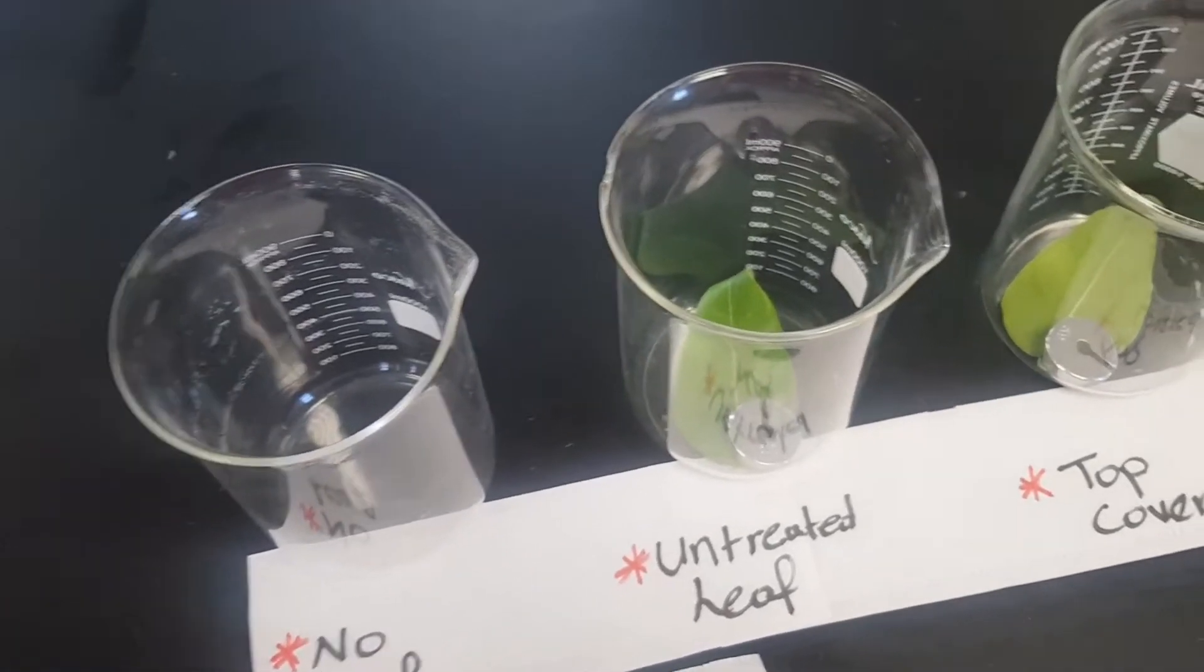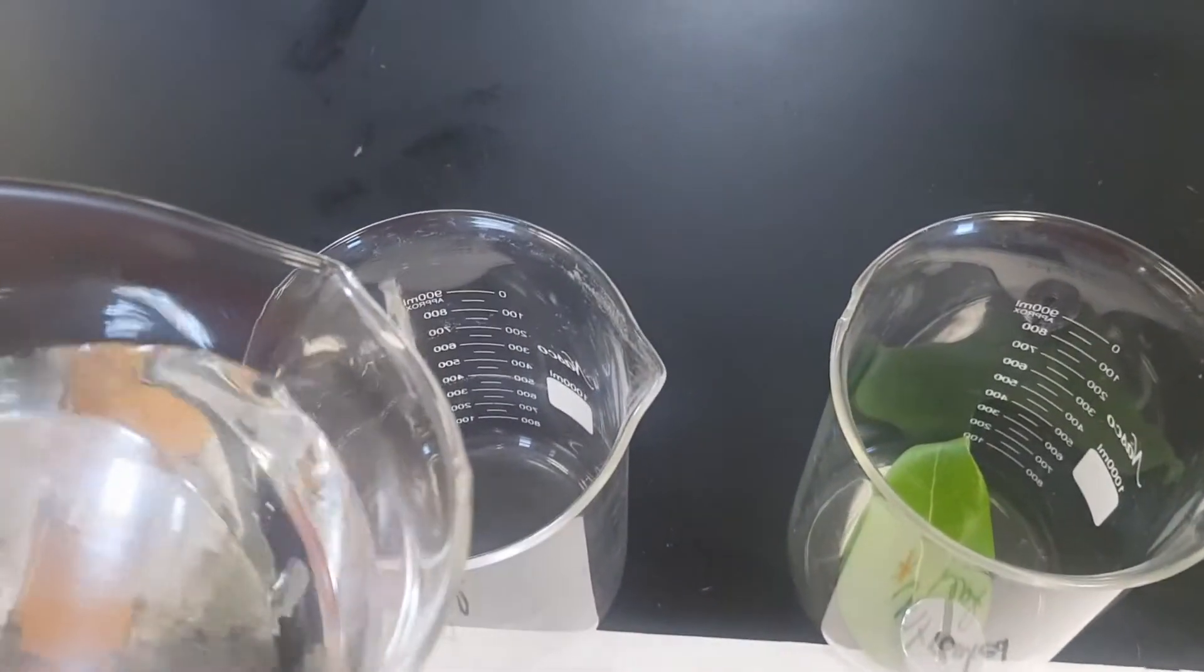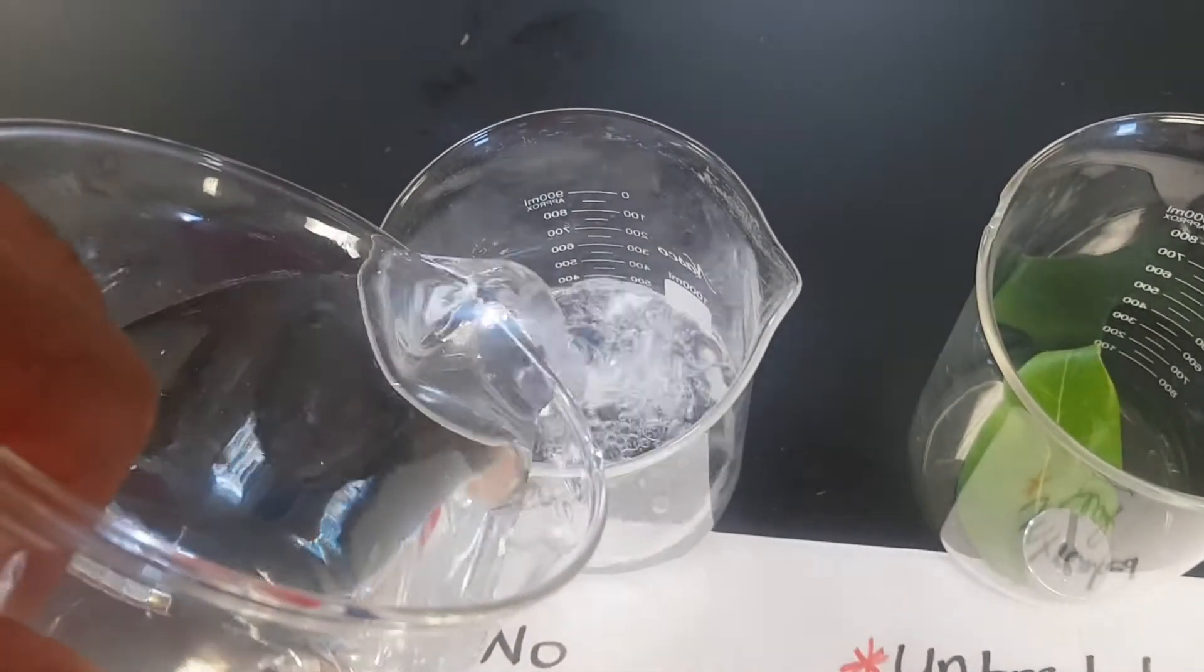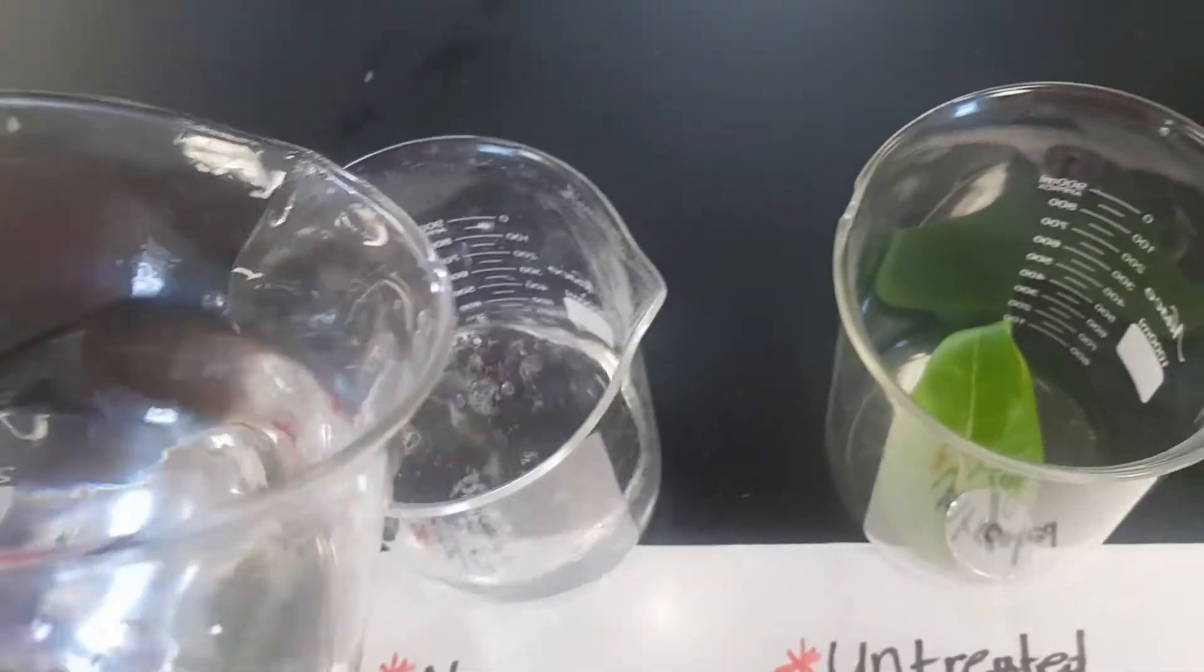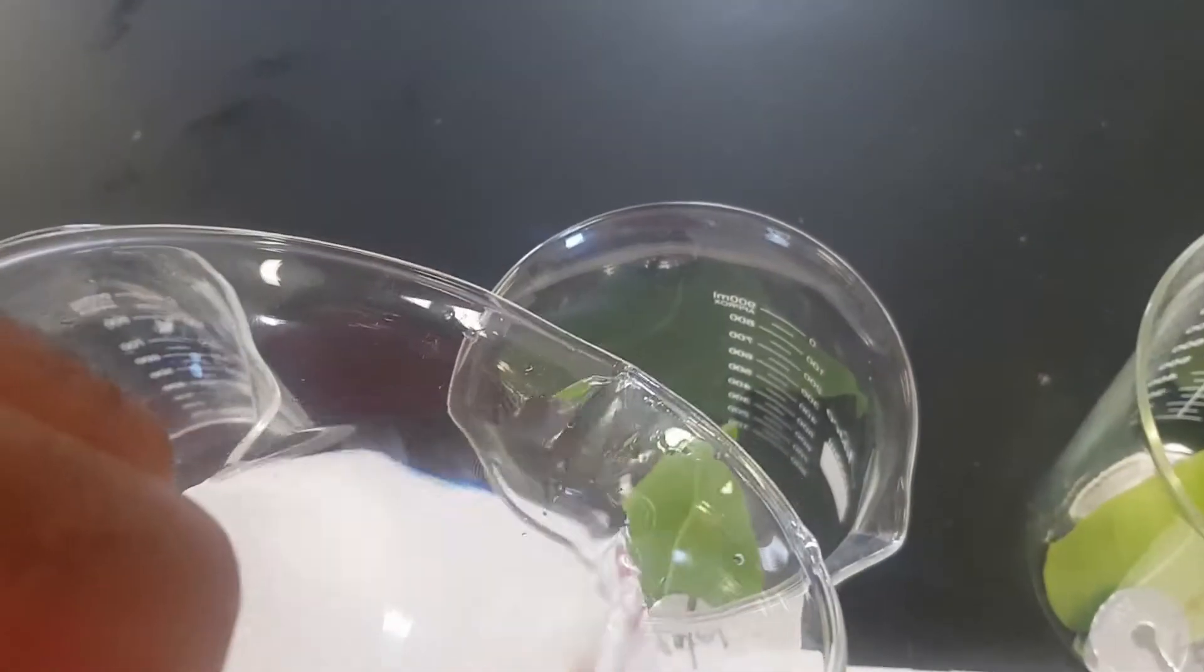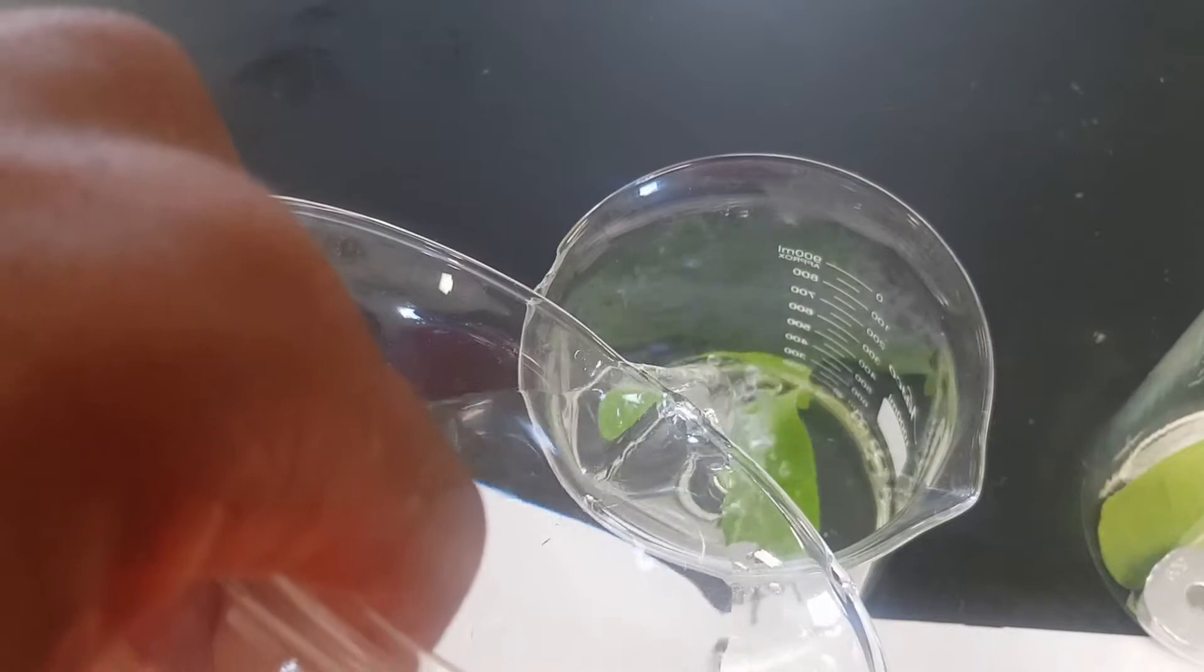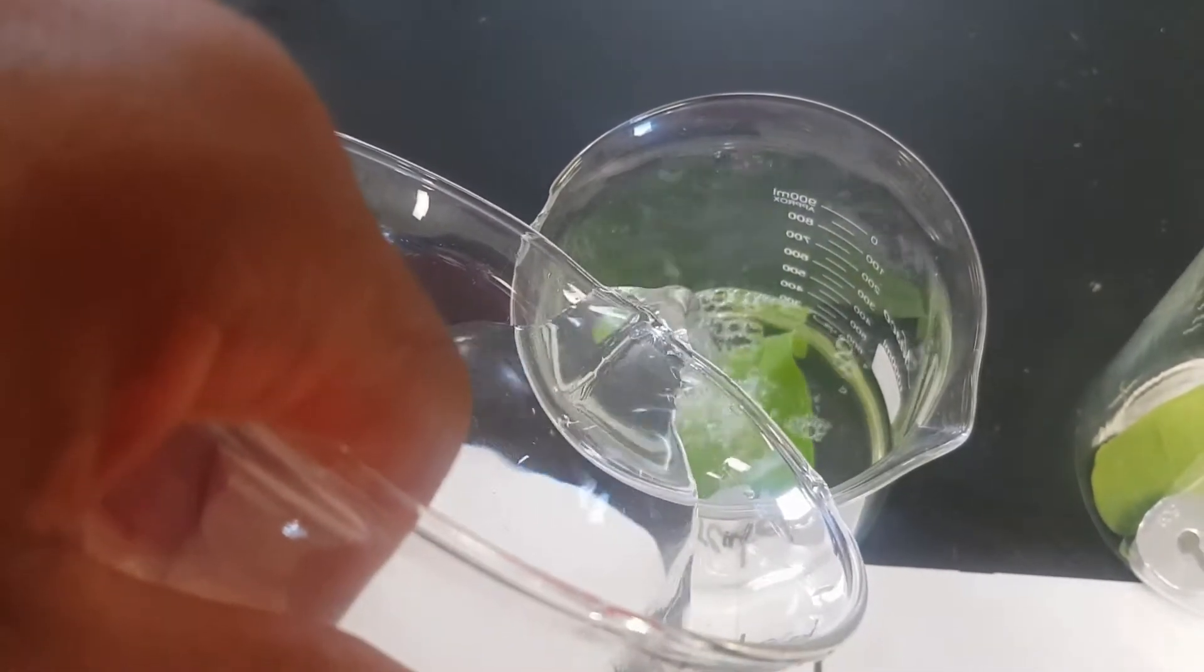Now we're going to pour equal amount of water in the beakers. Let's bring it up to almost 400. This one as well. It's going to take a time to make sure that there's no spillage.